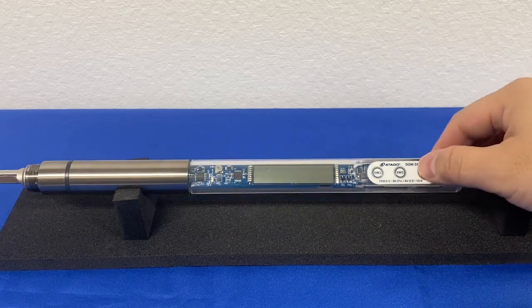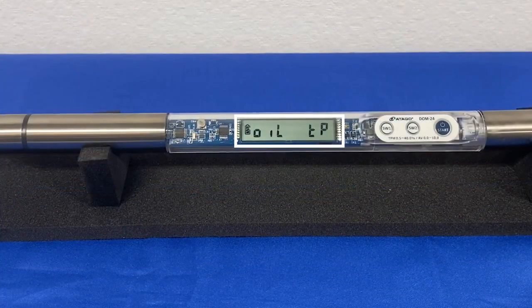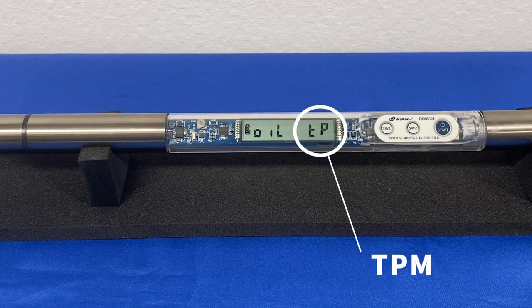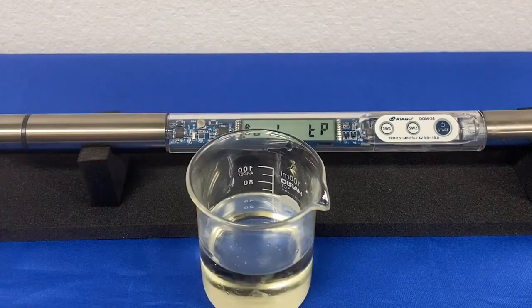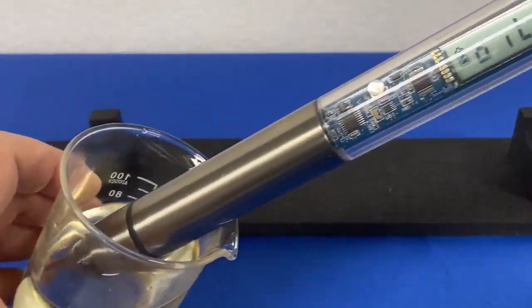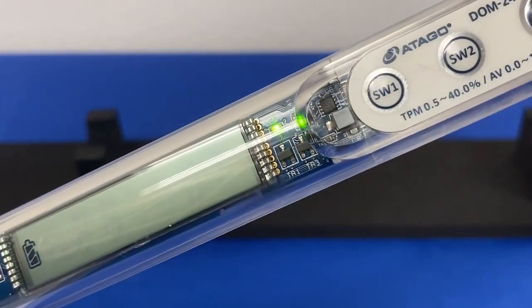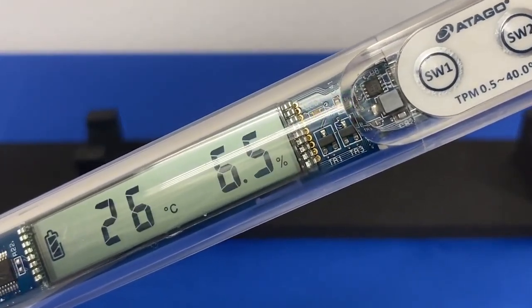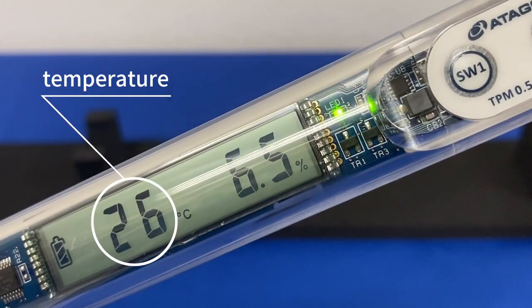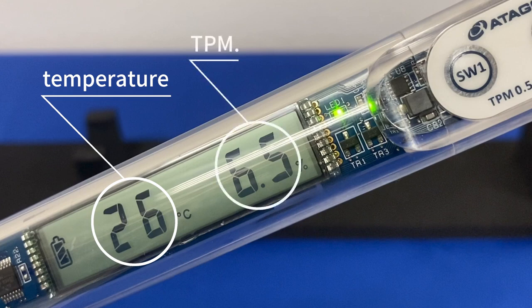After pressing start, the display will show 'Oil TP', which refers to TPM. Insert the DOM24 into some prepared oil and press start for measurement. When it stops blinking, the measurement and temperature will be displayed. The temperature is 26 degrees Celsius and the measurement result is 6.5% TPM.